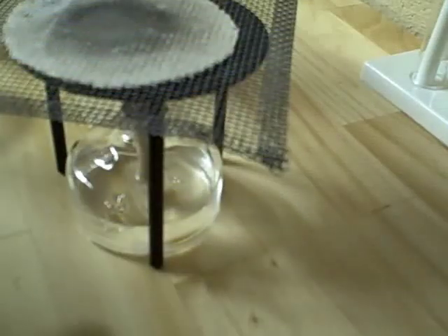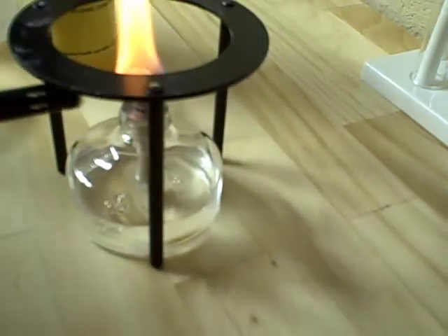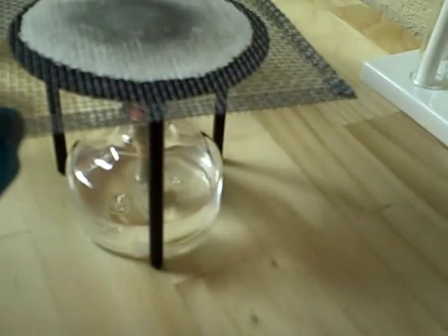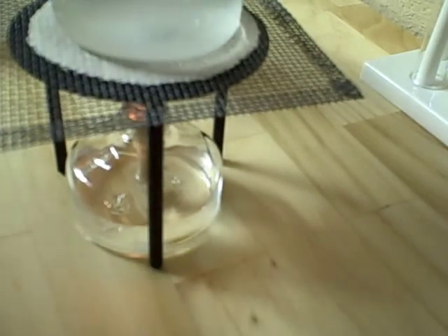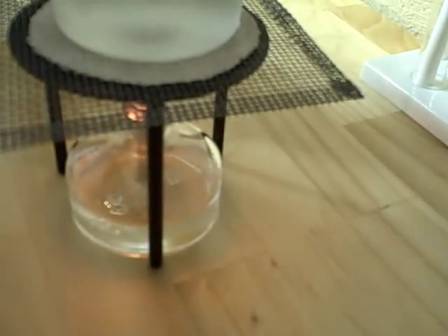I have some apparatus assembled for evaporation. Now we're going to light our burner. I'm going to put the wire gauze over it. And now here goes our sodium acetate. If you want to do this faster you can put it on the stove, however I'm just going to do it here.